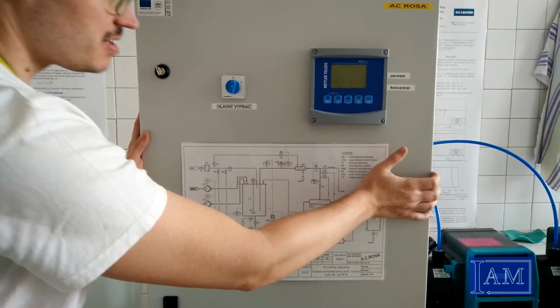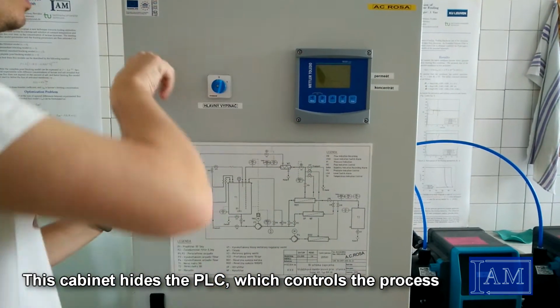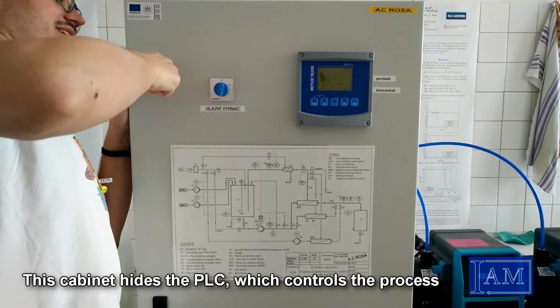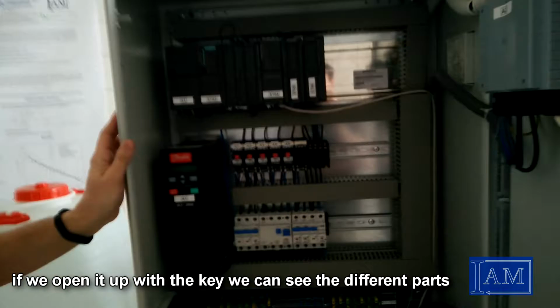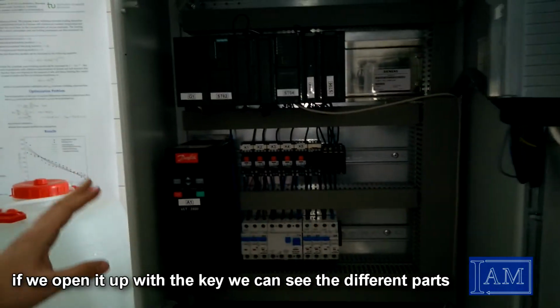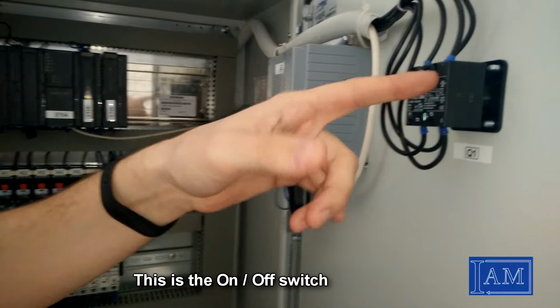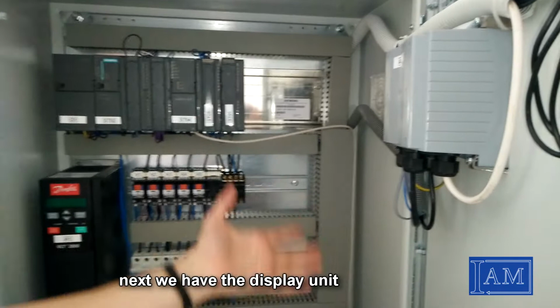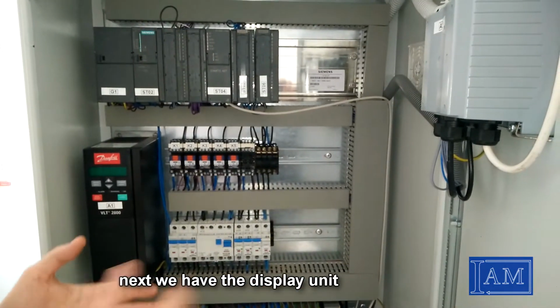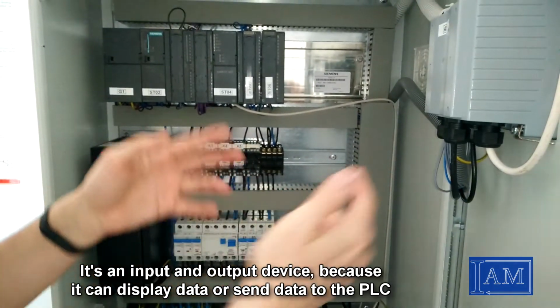This cabinet houses the PLC, which controls the process. If we open it up with the key, we can see the different parts of it. This is the on-off switch. Next we have the display unit. It's an input and output device because it can display data or send data to the PLC.